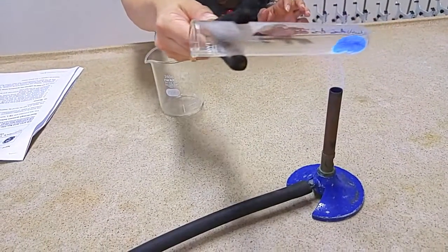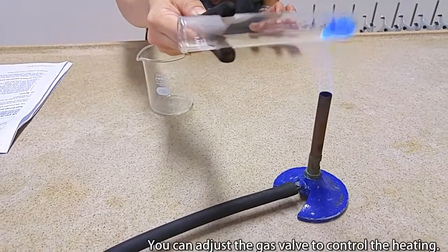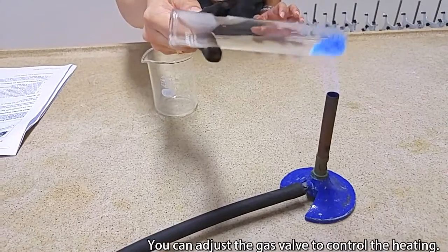Periodically heat the top to ensure that you drive water out of the boiling tube, shaking it lightly to break up the solids.